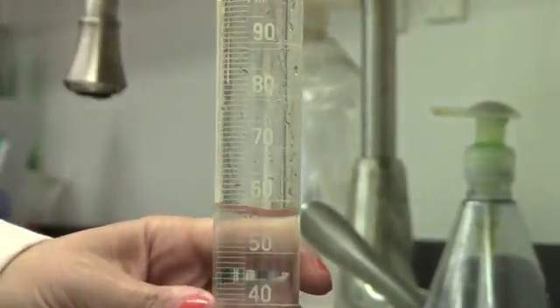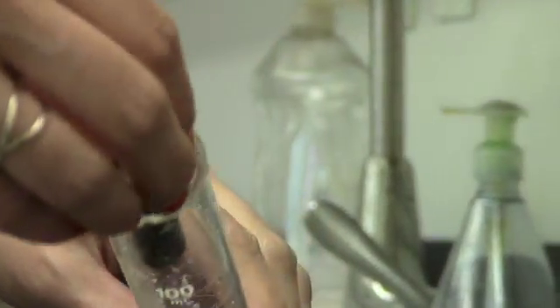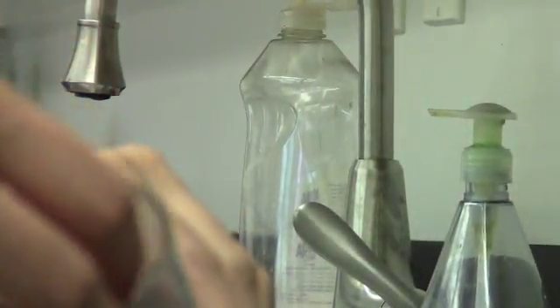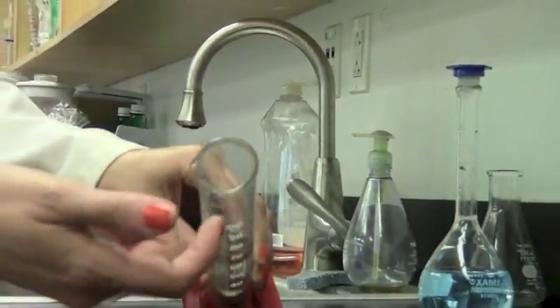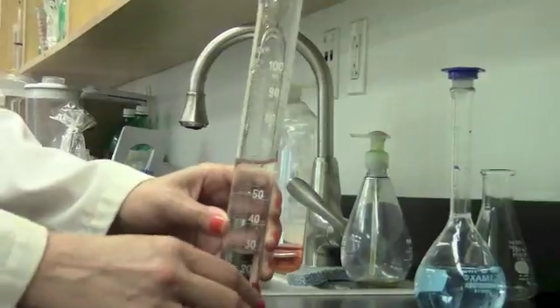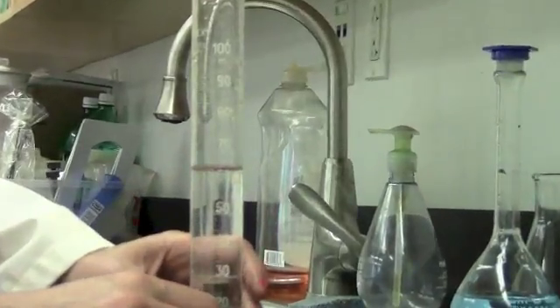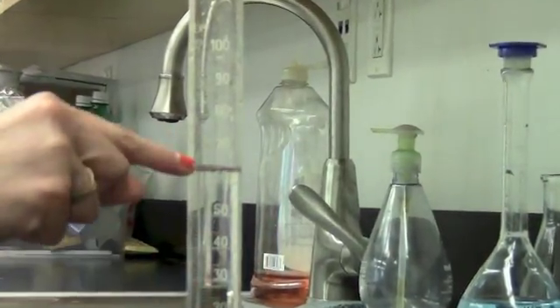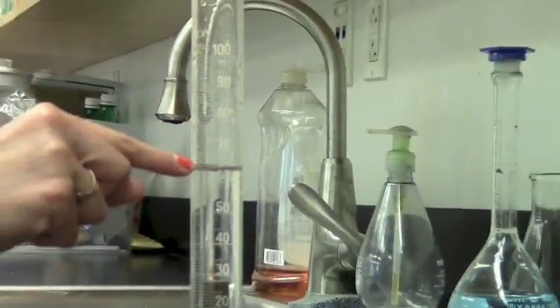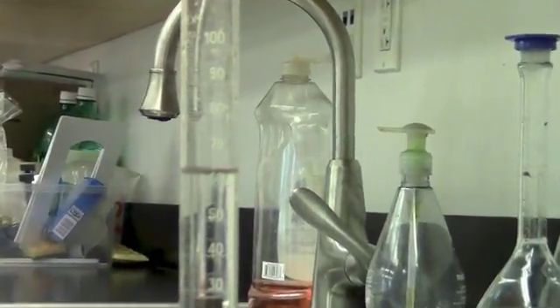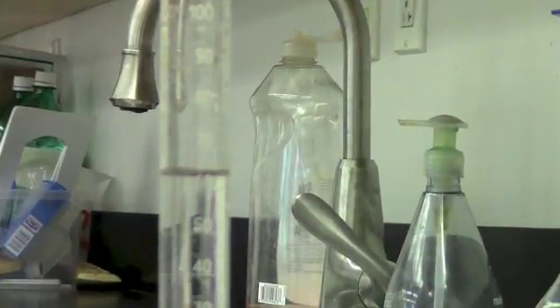Now, I'm going to carefully drop the cylinder into the graduated cylinder. It's important to tip the cylinder because this is glass and that's heavy, so it'll break the bottom if you just drop it straight down. You'll notice that the volume has now increased. The amount that the volume has increased is equal to the volume of the piece of the solid that I've put in there.